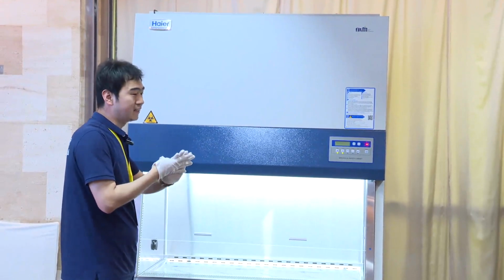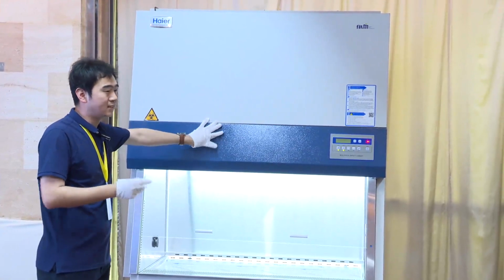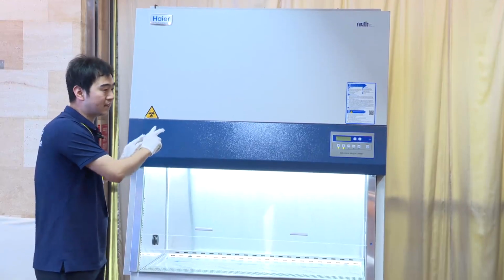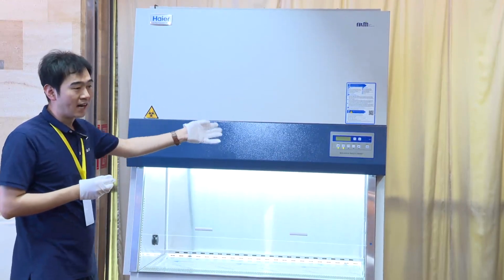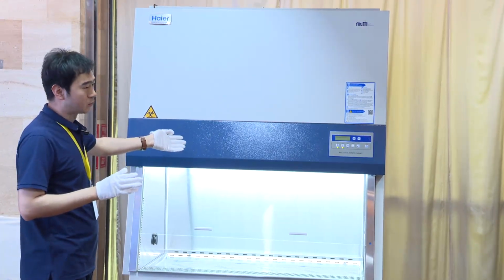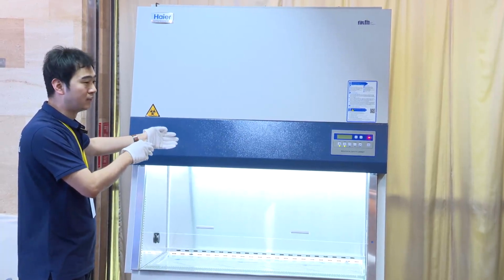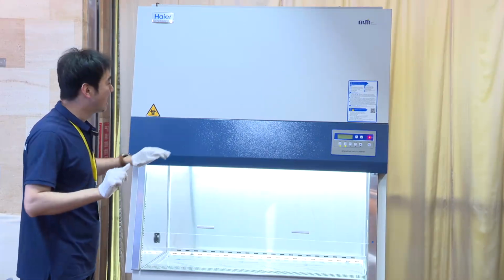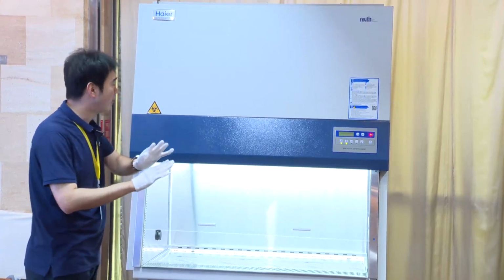And the fourth condition is that there are two pressure sensors inside. If a pressure sensor has some problem, it will alarm. And the final one is our control board issue, but normally this is not easy to happen. So regarding the 5 conditions, I will troubleshoot one by one.